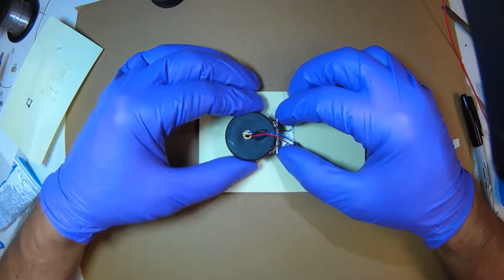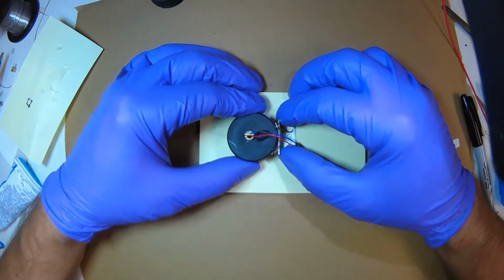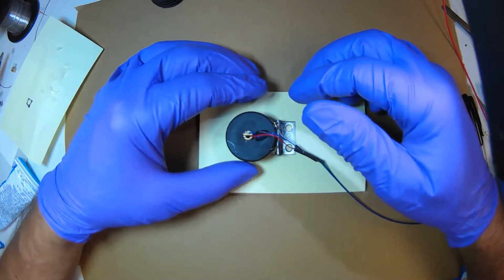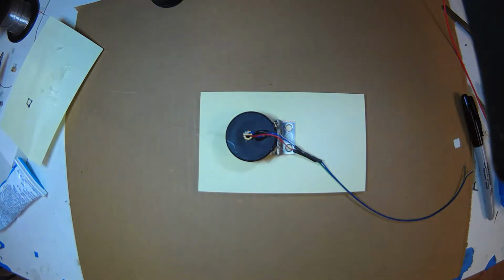And notice the circuit board is at right angles to the hinge, and since the laser beam is at right angles to the circuit board, the laser beam will be parallel to the hinge, so we can move it forward and backwards along the box to align the beam to the image chip. We do that when it's live, when we're imaging it. Okay, it's hard enough that I can let go. Once it hardens, I'll fill in more hot glue.